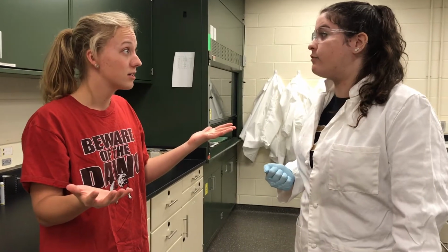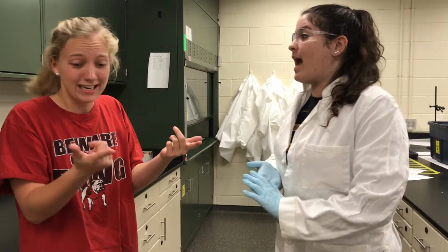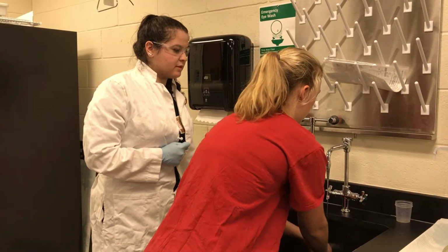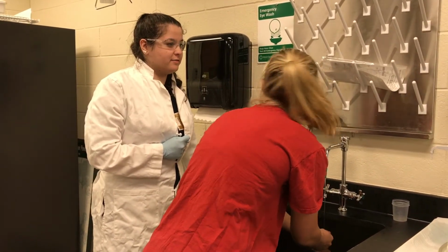We need to wash your hands for 15 minutes. 15 minutes? How many is that? It's okay, I'll count for you. Let's go to the sink. Okay. You know, if you've been wearing the gloves, this wouldn't have happened.